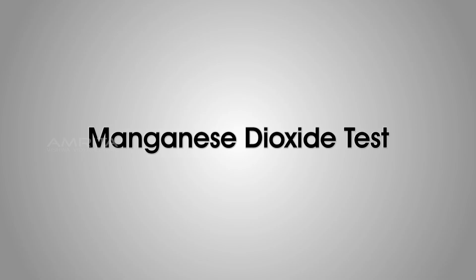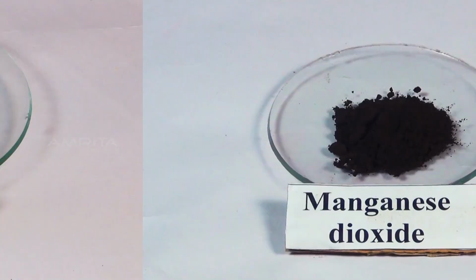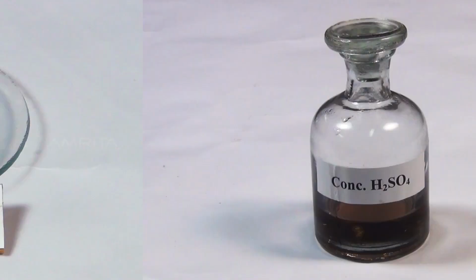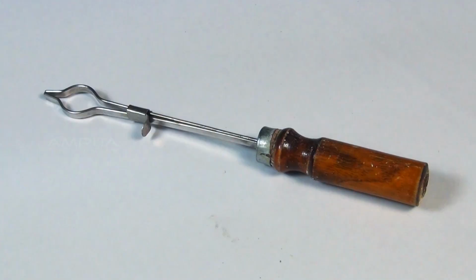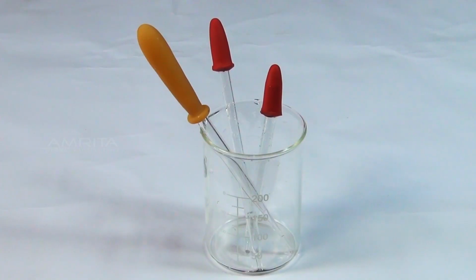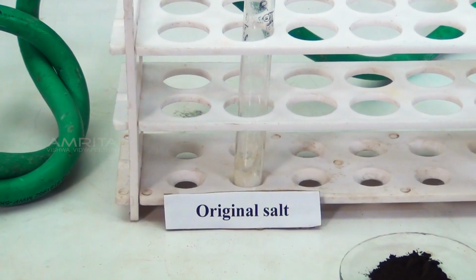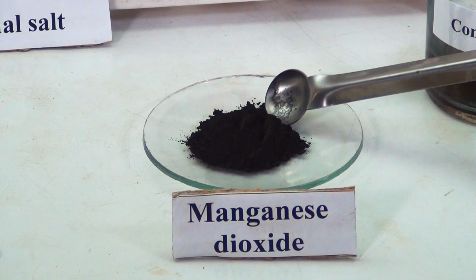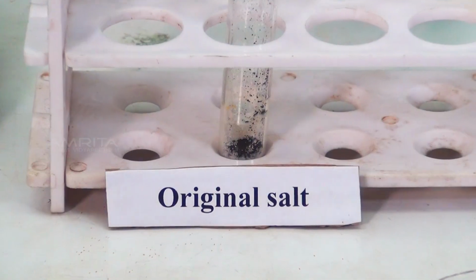Manganese dioxide test. Materials required: original salt, manganese dioxide, concentrated sulfuric acid, test tube holder, spatula, dropper, and a Bunsen burner. Procedure: take a small quantity of the salt in a test tube. To this, add a small amount of manganese dioxide powder using the spatula.